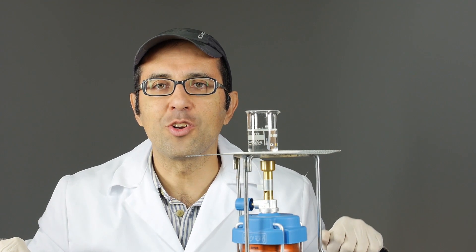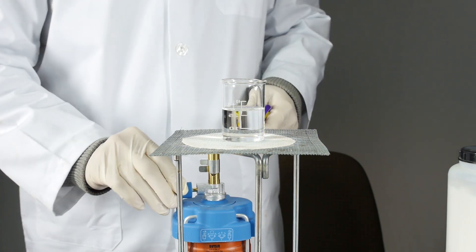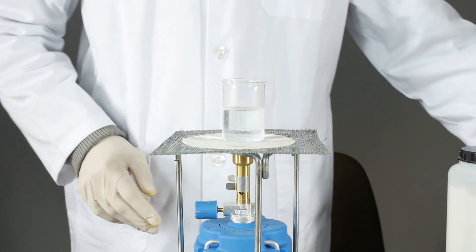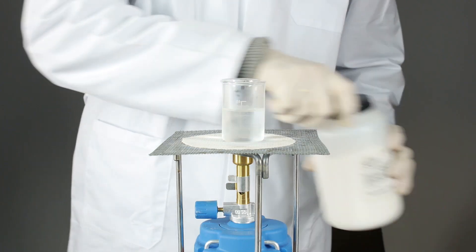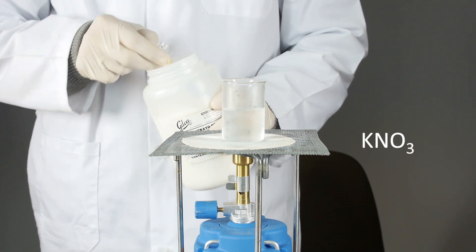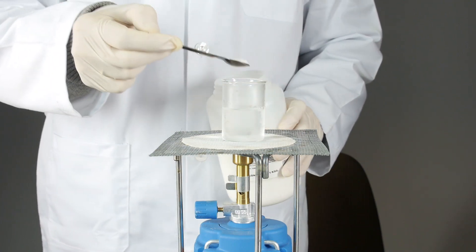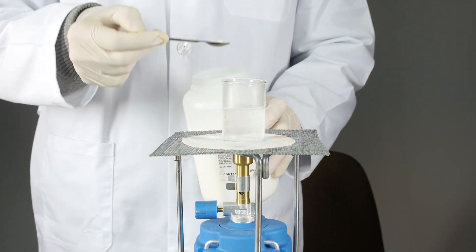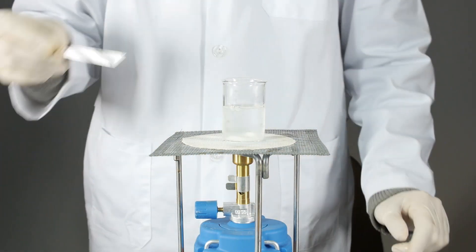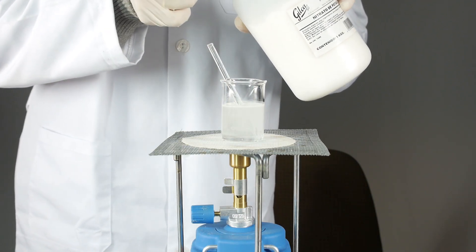Now I am going to perform a quick crystallization experiment. I am going to prepare a supersaturated solution of potassium nitrate. For this we will heat the water to get the maximum amount of solute dissolved. I add more solute, that is potassium nitrate.